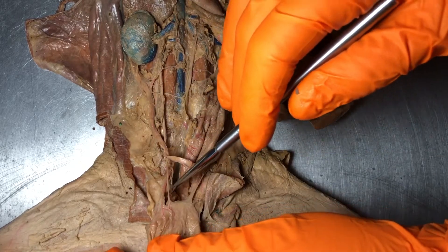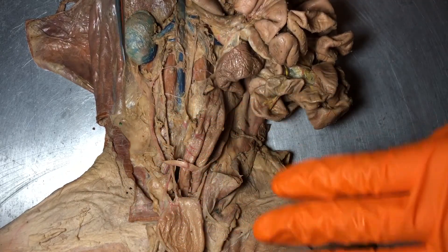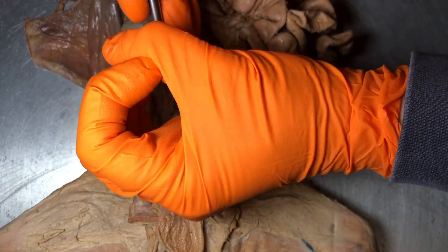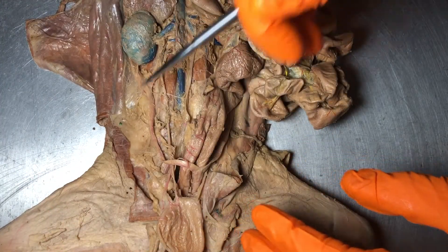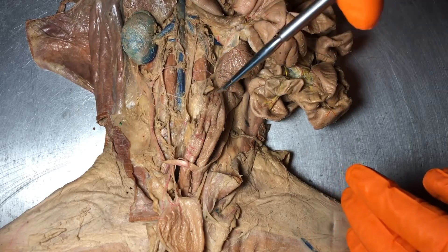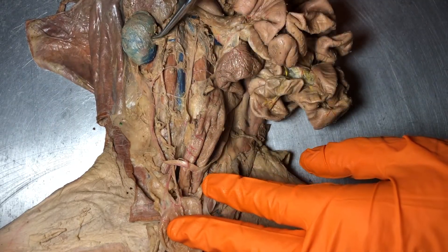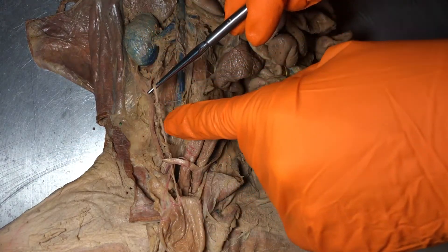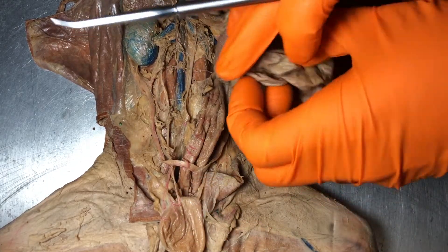This small tube right here comes from the kidney. I always suggest this: when you're on a quiz and you see a pin right here, I always recommend widening your view so you can see the context of that pin. Remember that the ureters connect the kidney to the urinary bladder. So this tube that comes out of that renal hilus — you can see it right here — connects to the bladder, which means this is the right ureter.